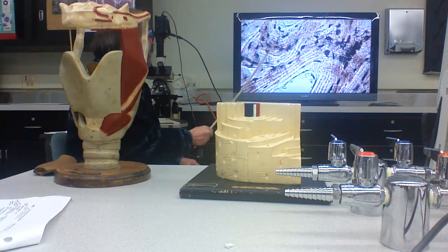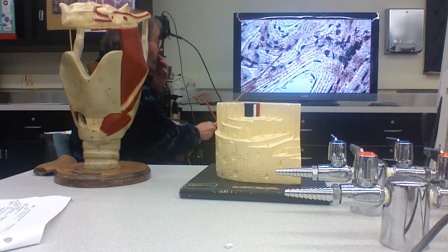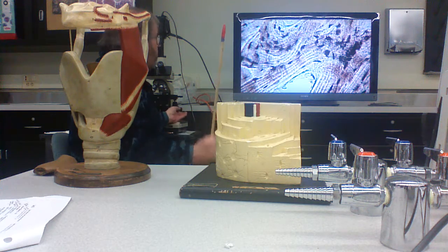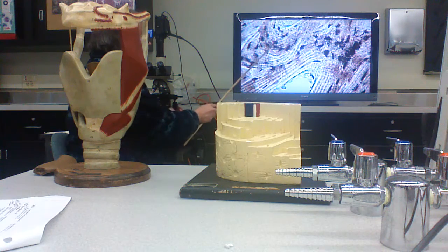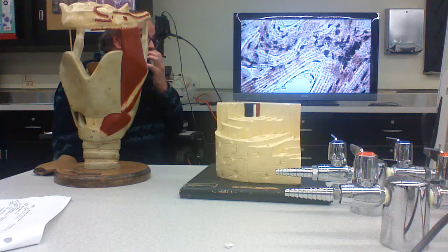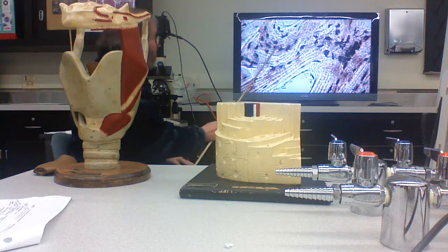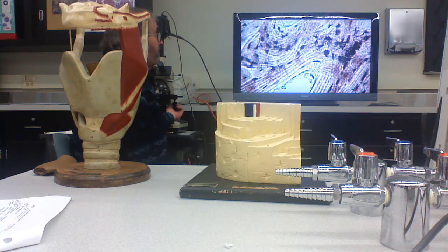These are called canaliculi. They're just the openings where you used to have little pseudopods. But the point is that all of these cells are in contact with each other and can exchange things. And they're all in contact with a Haversian canal or a Volkmann canal.